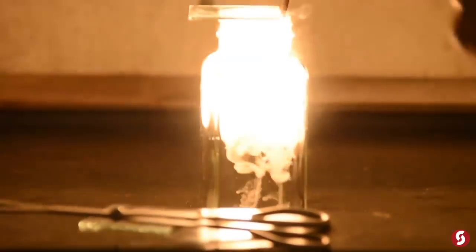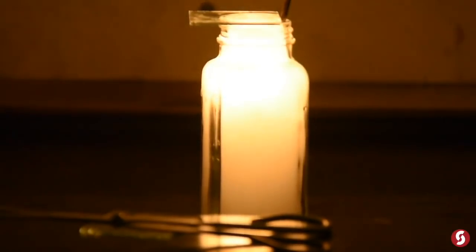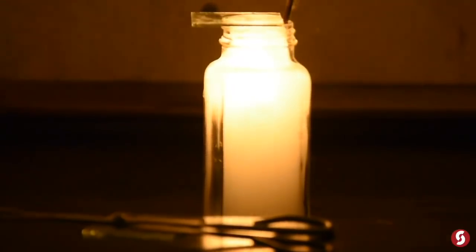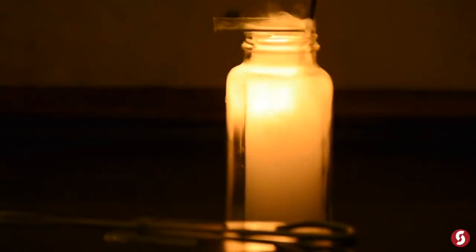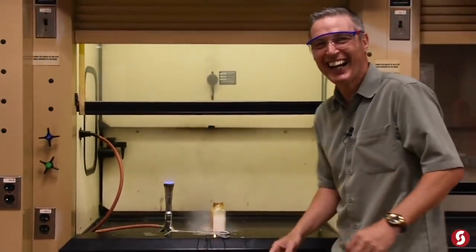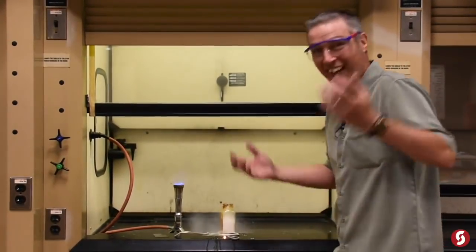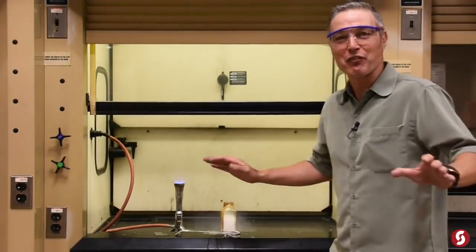Into the pure oxygen. Bang! Look at that. Now that white stuff you can see there, that's the oxides of phosphorus, which are solid, making a little cloud of solid. Oh jeez, we did it. All right. Well, that made the point. Okay, enough of phosphorus. And I'm more scared of the next thing, which is magnesium.